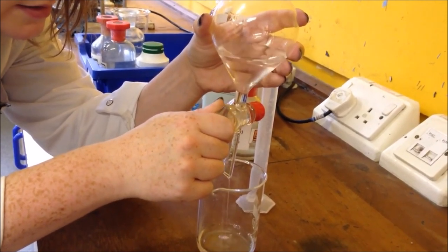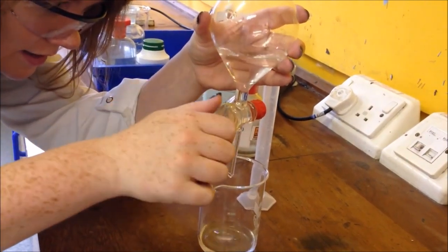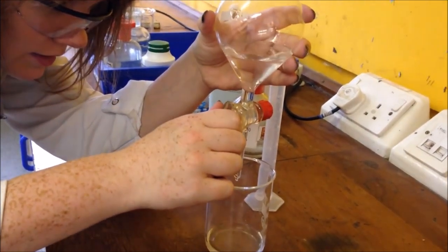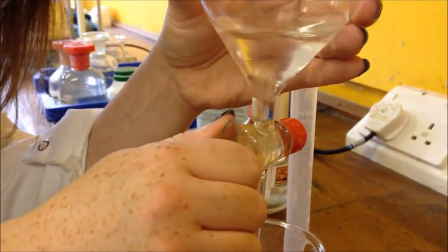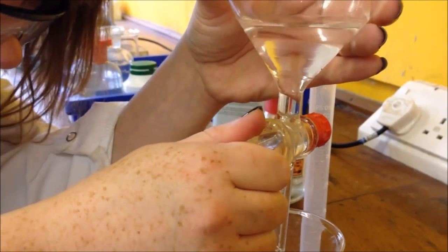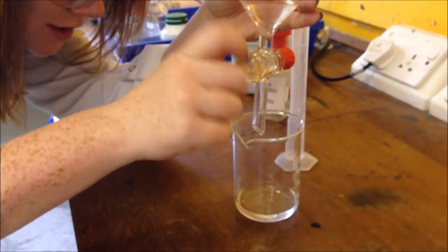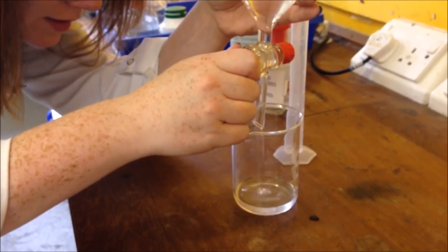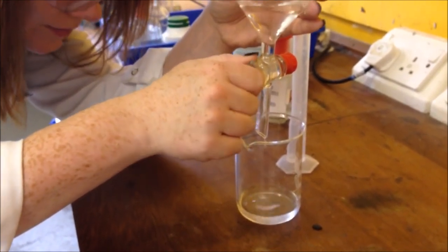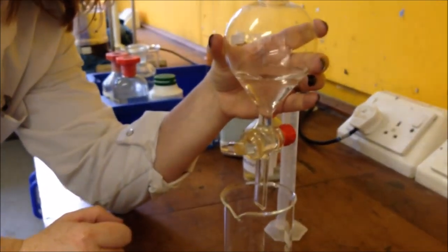So I'm just going to slow that down because I don't like bubbles. You can see the layer is just here. Stop that. Drop a couple more since I can still see the layer which is just about here now. Now in here I just have my top layer and that's what I'm going to use for the next parts.